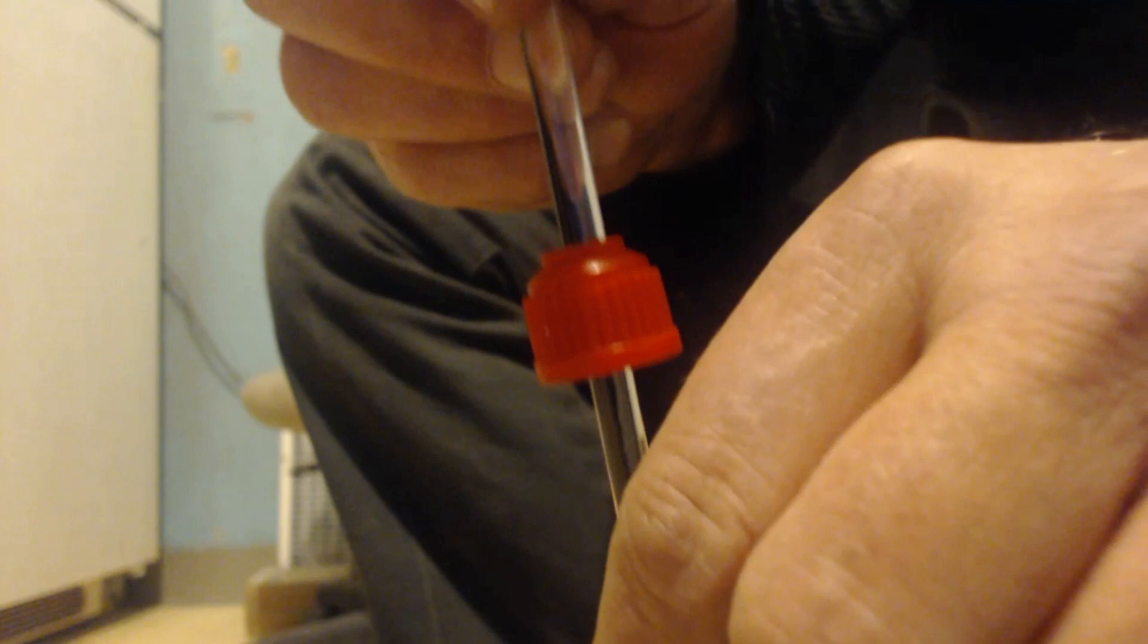But it's still snug when it... and you saw when I had the weight of the glass on here, that holds.